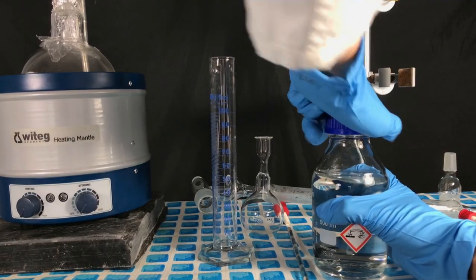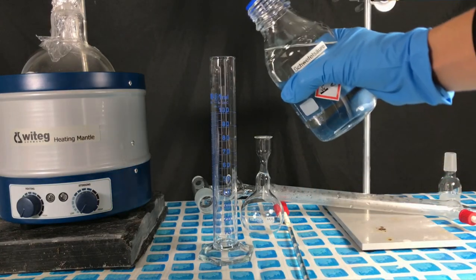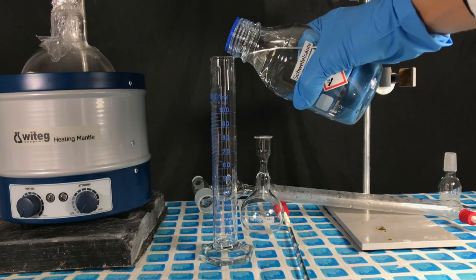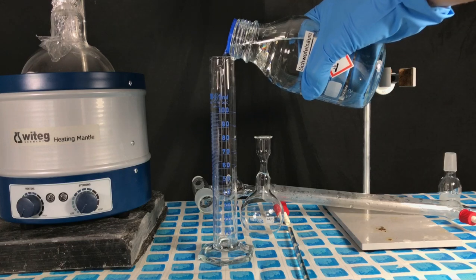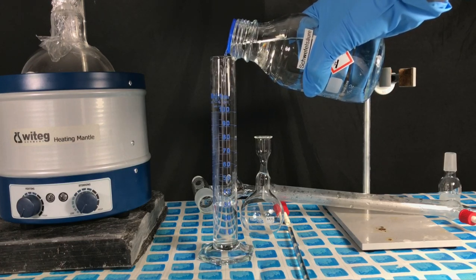I have never tried this synthesis before and for this reason 50 milliliters of the 150 milliliters in total of 96% sulfuric acid were measured out and directly transferred to the phosphorus pentoxide flask.